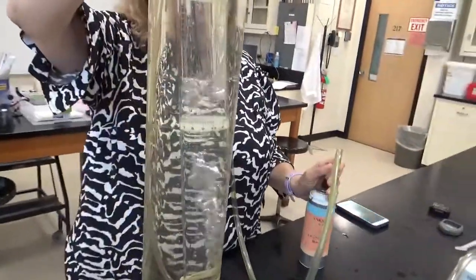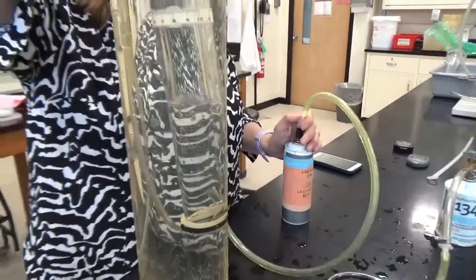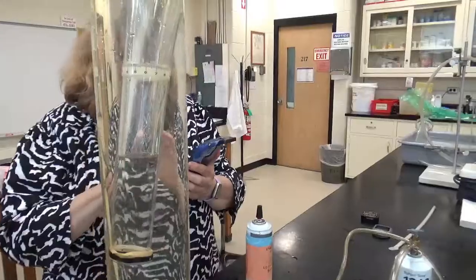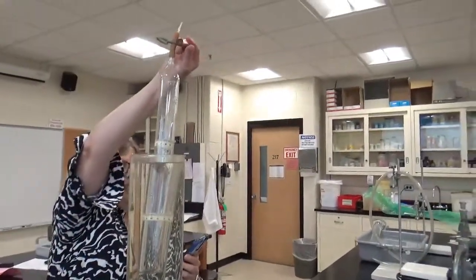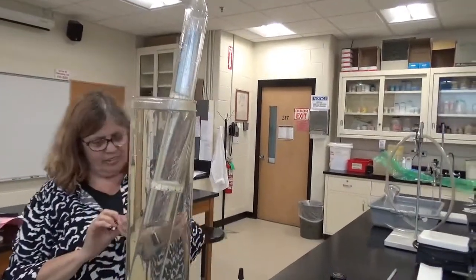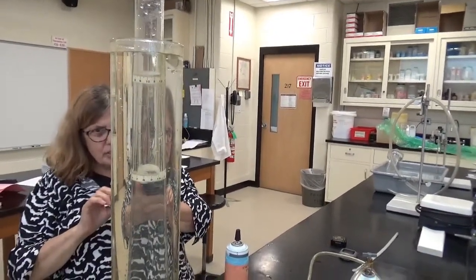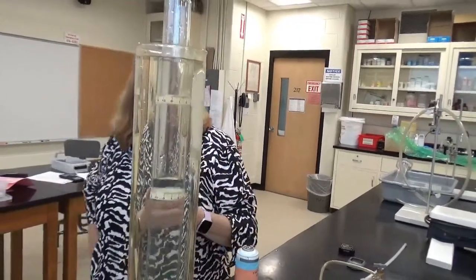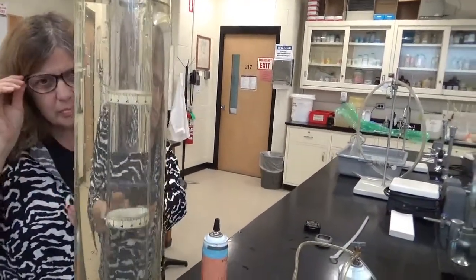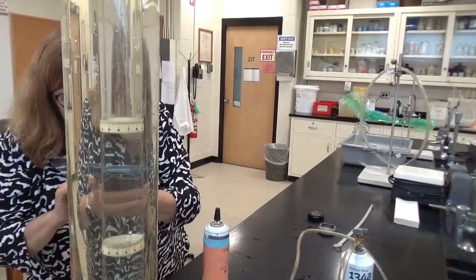Okay. Give myself a little longer to get ready. Take this out. All right. A nice long time here. Start. Stop.